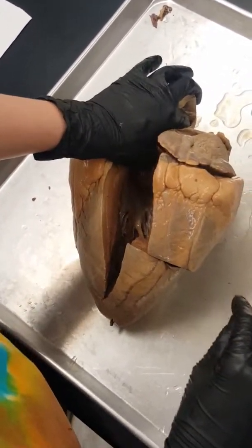Just to go over the outside again: the apex of the heart is the bottom, the base is the top, the auricles are our pouches, and the inside — the atrium — is the opening. You can think 'auditorium' for atrium — a big open space. And then right in here, how we get up into our aorta, this is going to be the left ventricle down here.